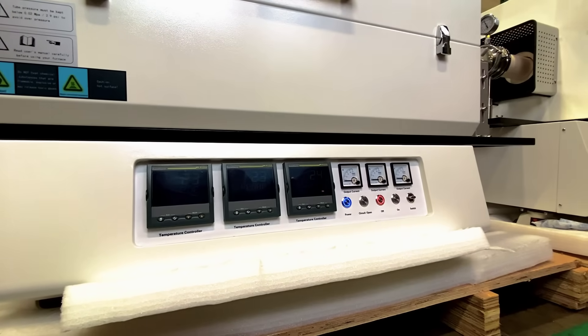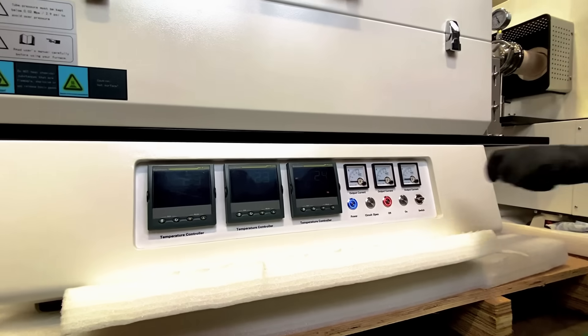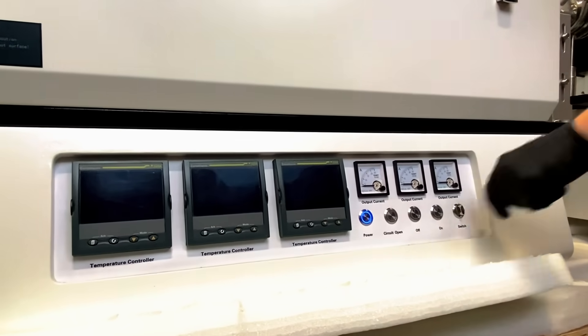Turn off in order to end the cycle. And don't forget to switch your furnace off.